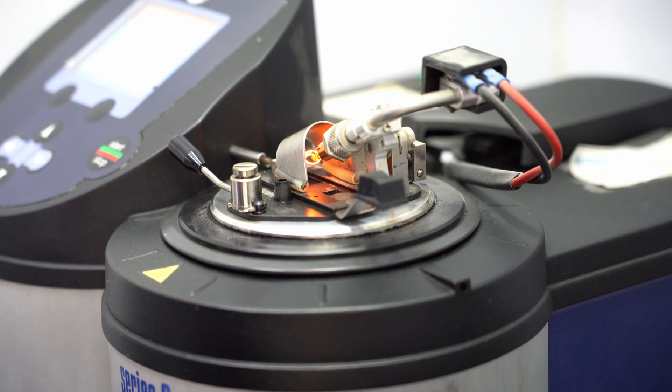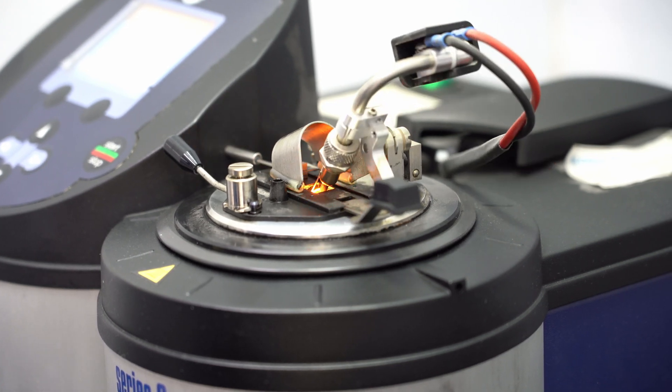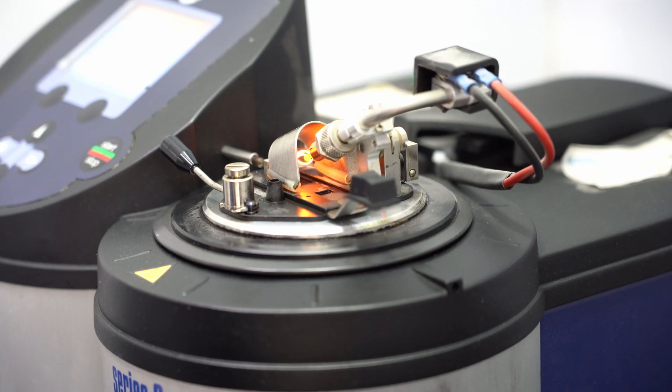If fuel is present, a flash will be observed. The temperature at which the flash occurred is related to the amount of fuel in the engine oil sample.